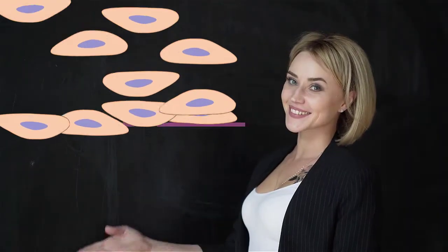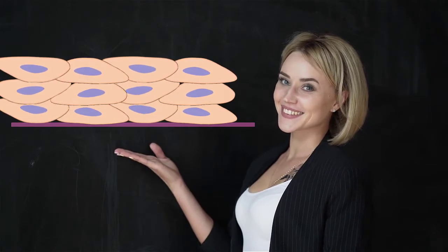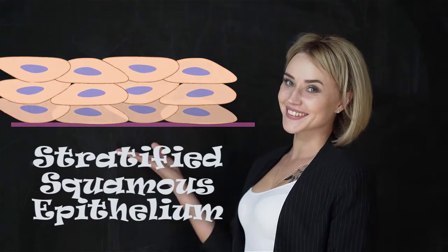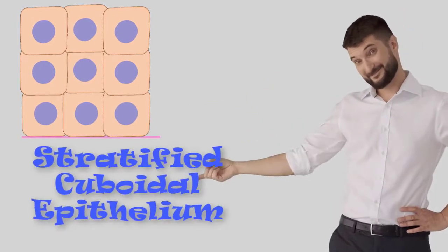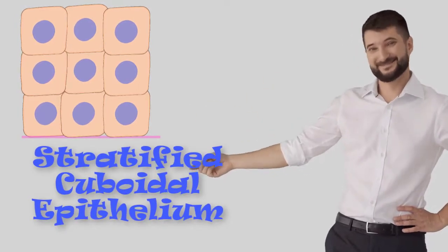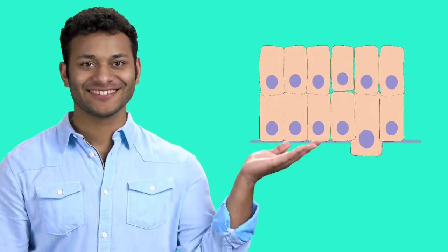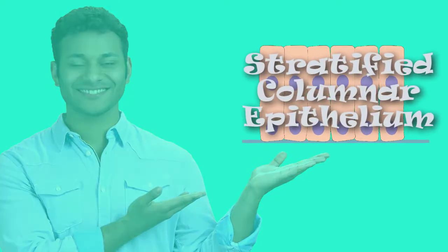When a tissue is made up of more than one squamous epithelial cell layer, it is called stratified squamous epithelium. Similarly, when we have more than one cell layer of cuboidal epithelial cells, this is called stratified cuboidal epithelium. And a tissue made up of more than one layer of columnar epithelial cells would be called stratified columnar epithelium.